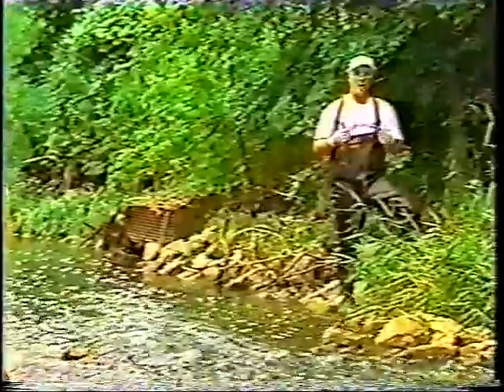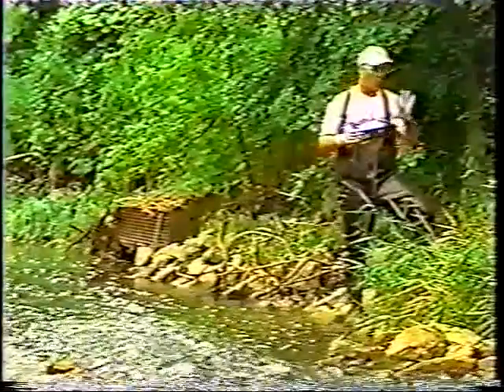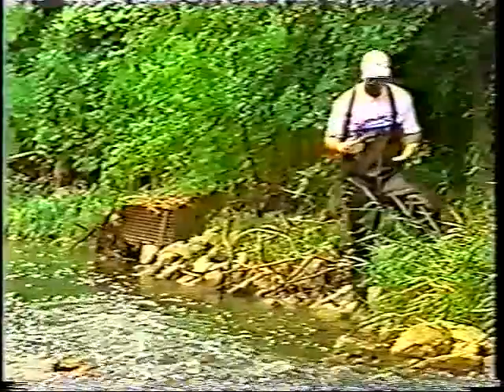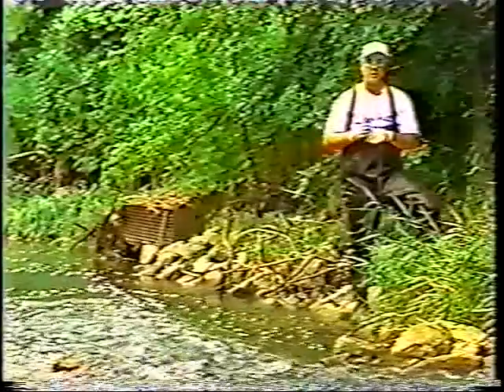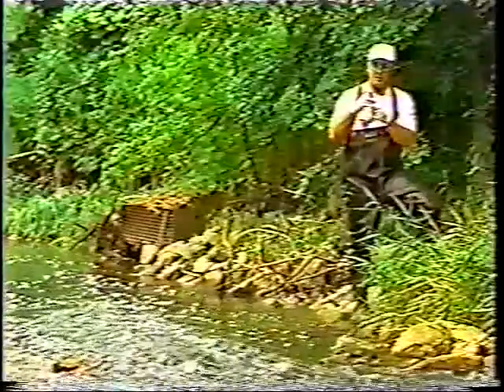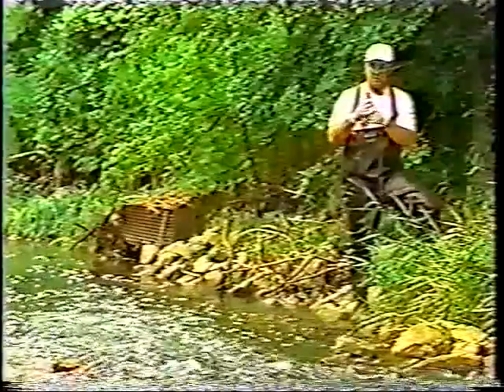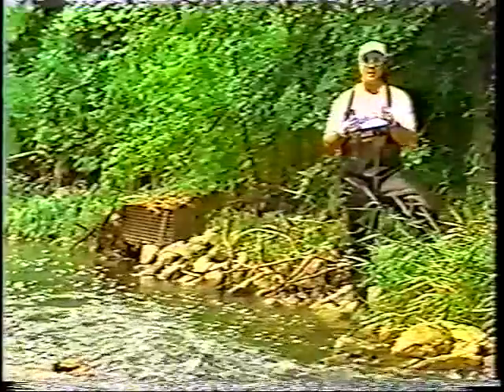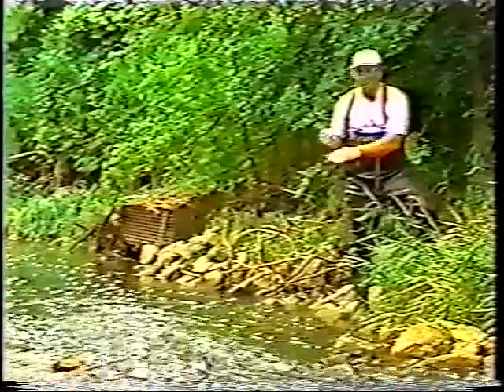Now that we've calibrated the pH meter, we're ready to actually go down by the river, make sure that we're water ready. I got my gloves on, my goggles on, my safety equipment. You do not need waders to collect this information. But what you need to do is take your calibrated pH meter and make sure it's on and it's set at 7.0. And now you're going to collect the pH in a quiet pool, and that's where I'm at right here down below this ripple.